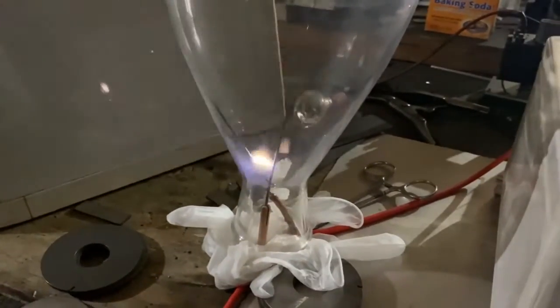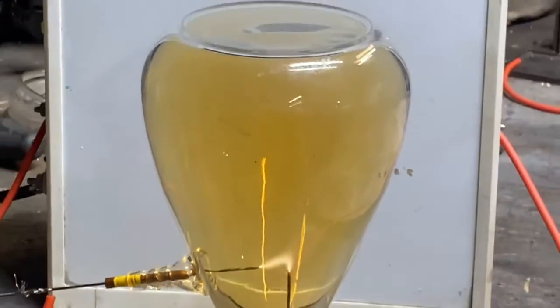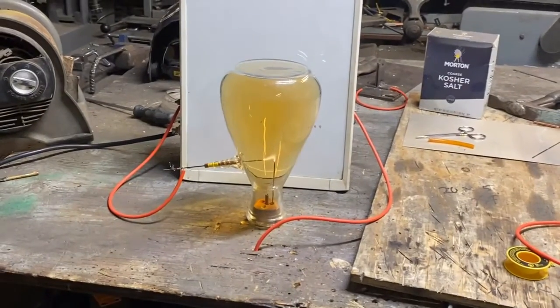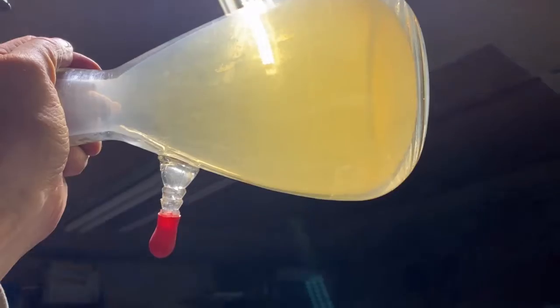We observed that these large plasma-type sparks are more compatible with ozone production than they are with nitric oxide. The tiny, hot arc gives us that 3000°C, but tungsten metal was not compatible with this process due to the tungsten oxide that's produced at around 800 degrees Fahrenheit.